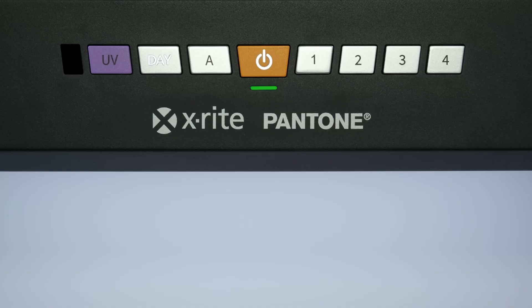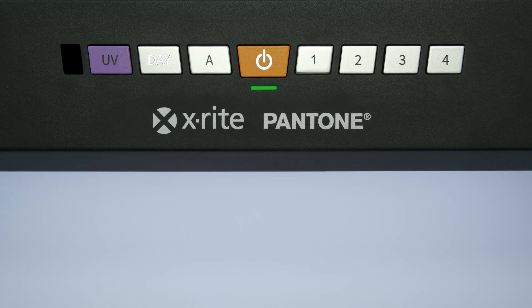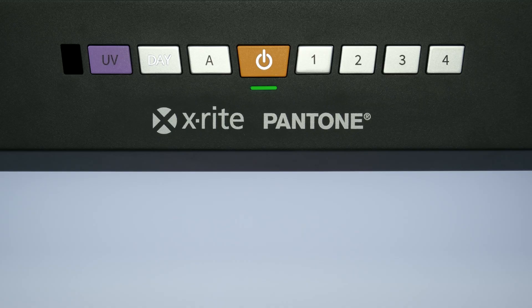The status LED indicates when the illuminants are nearing the end of their life. If the LED is green, the illuminants are within the manufacturer's stated lifetime and no action is required.